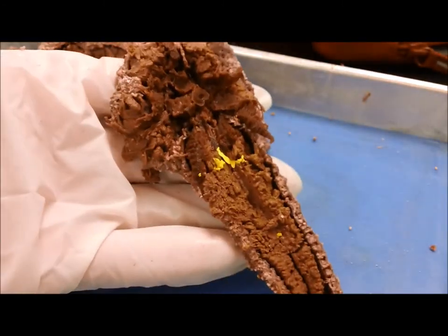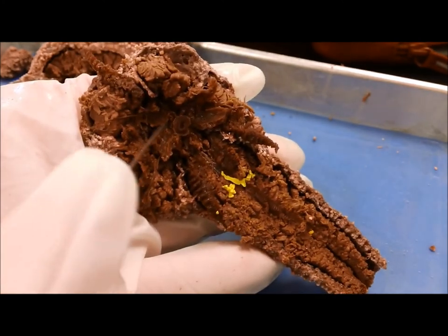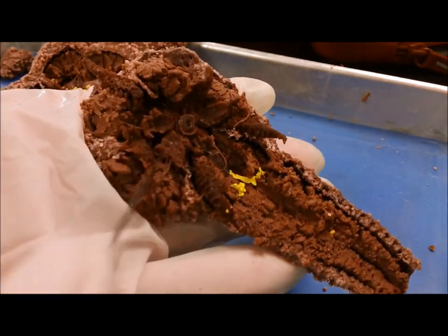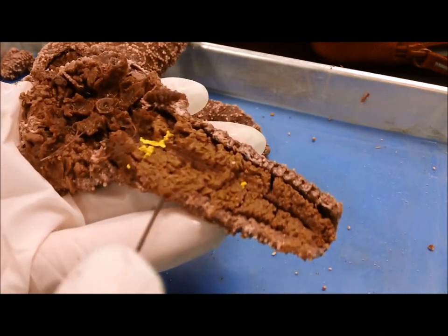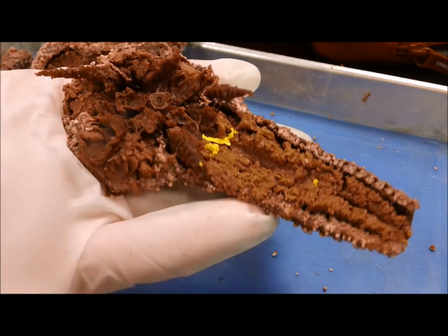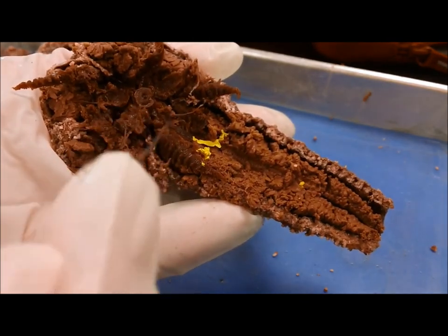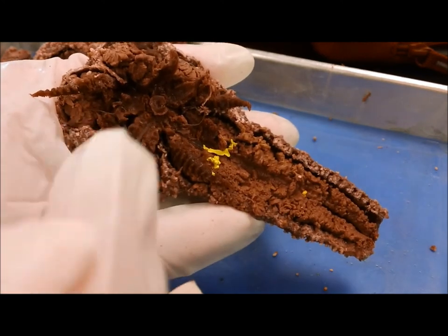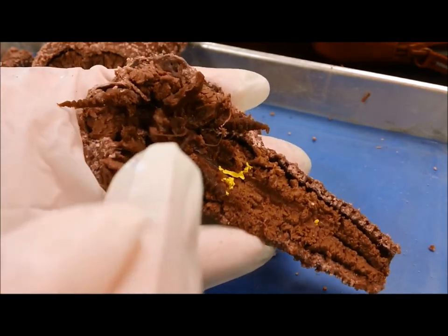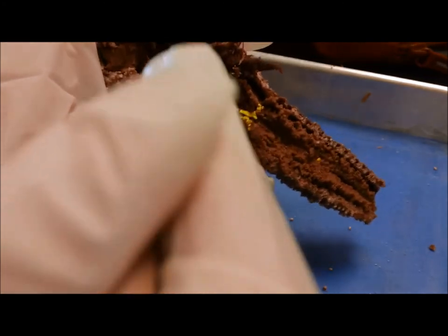So you can see here the stomach, and you see the mouth right there. That's literally the entrance to the stomach, and you can see how the stomach kind of has a little five-star shape too. And then it runs into — now I've squished this a little so it's not as nice looking. Here you've got the various reproductive organs of the starfish, and you can actually make out some of the nerves here as well. There is a central ring in this area — it doesn't have a brain, it just has this central ring of nerves. This here is all part of the stomach, and if you look down a little further, you can see some more of the stomach in there.